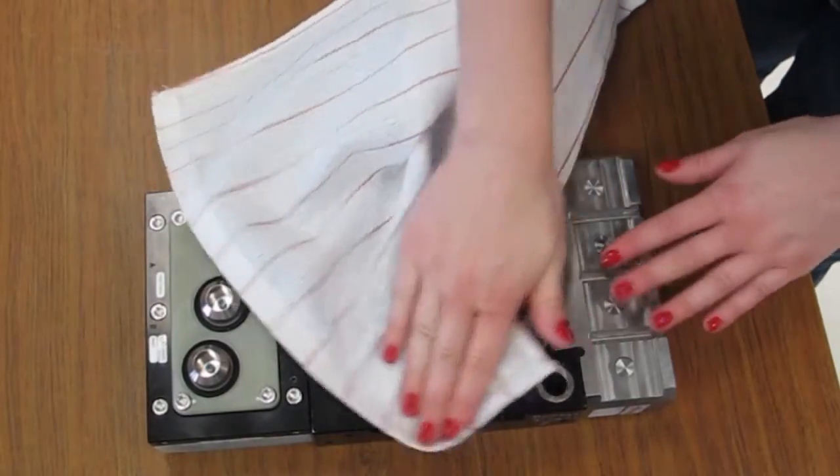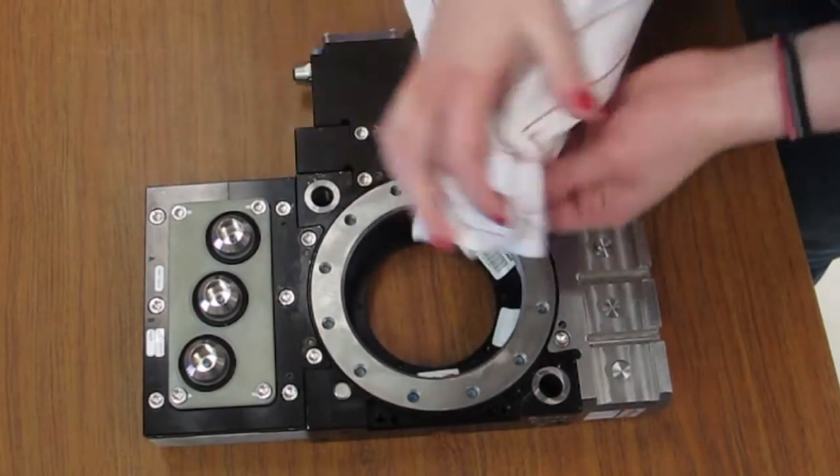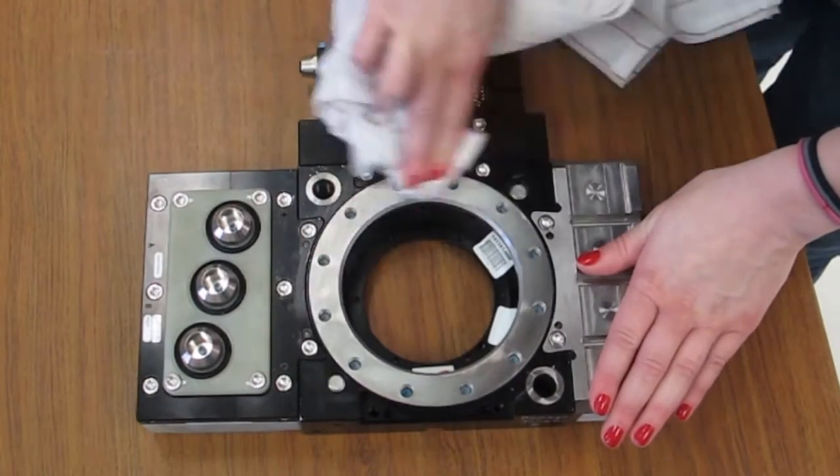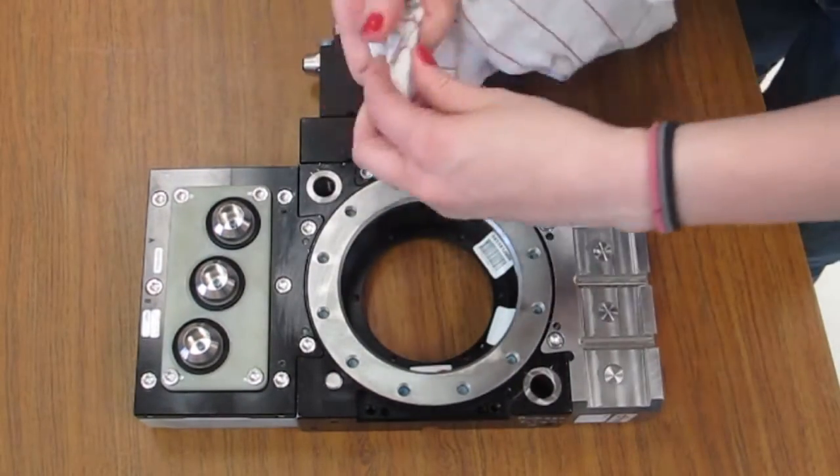Use a clean rag to thoroughly remove any lubricant and debris from the tool plate. No lubrication is necessary on the tool plate components.